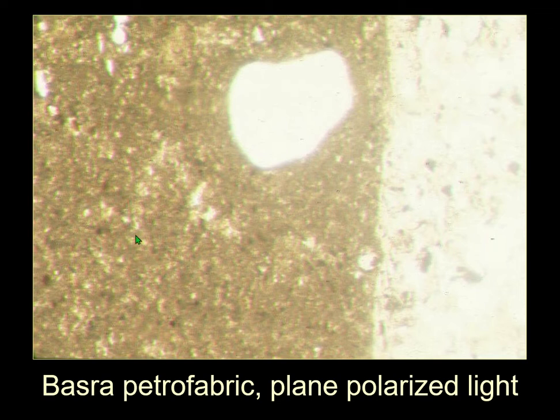And so the fact that this is from an inclusion-deprived sediment is actually evidence. And the fact that you do get the occasional thing, and it has Aeolian sand in it from the desert, far too often for it to just be the occasional wind-blown thing. There is naturally in the sediment wind-blown sand. You can see it's well-rounded, typically quartz, occasionally feldspar.